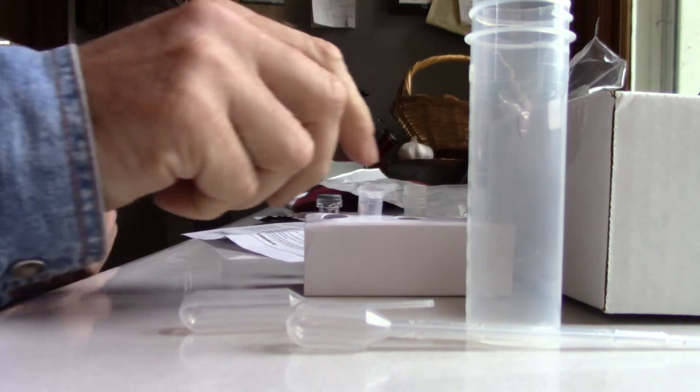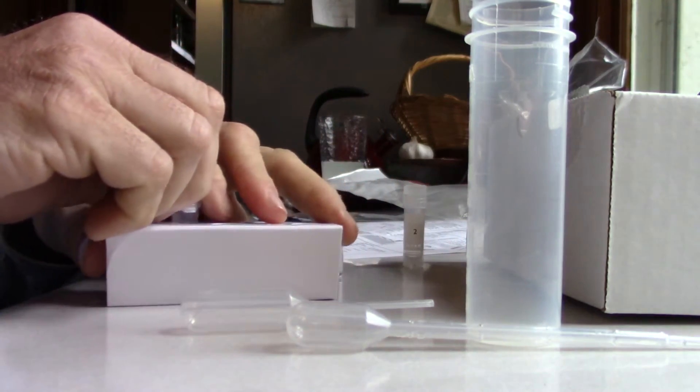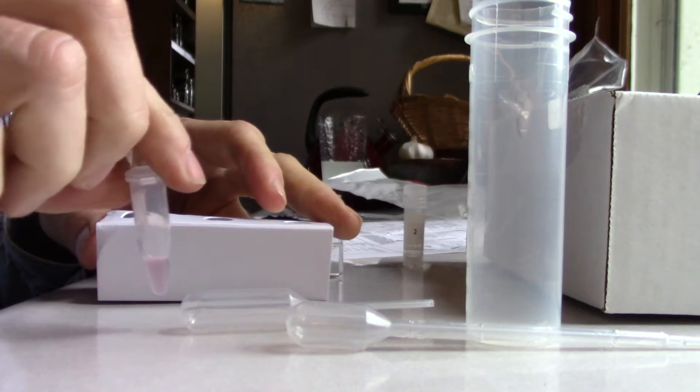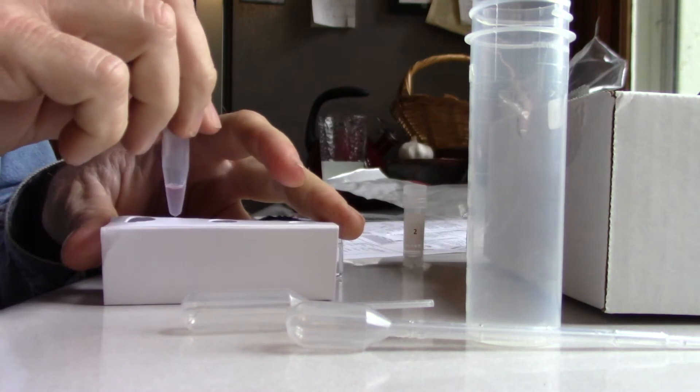This is up. Here's the vial number four.